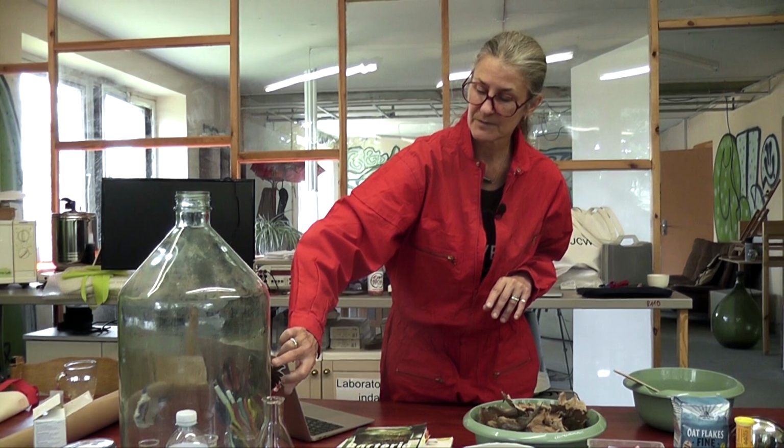You might find yourself surprised to see there might be a splotch of purple or a line of green or something rusty or something very, very dark. But these different subtle colorations will start to form. And those will change over the years depending on the weather, heat, where you position it. And those are also elements that you can experiment with.